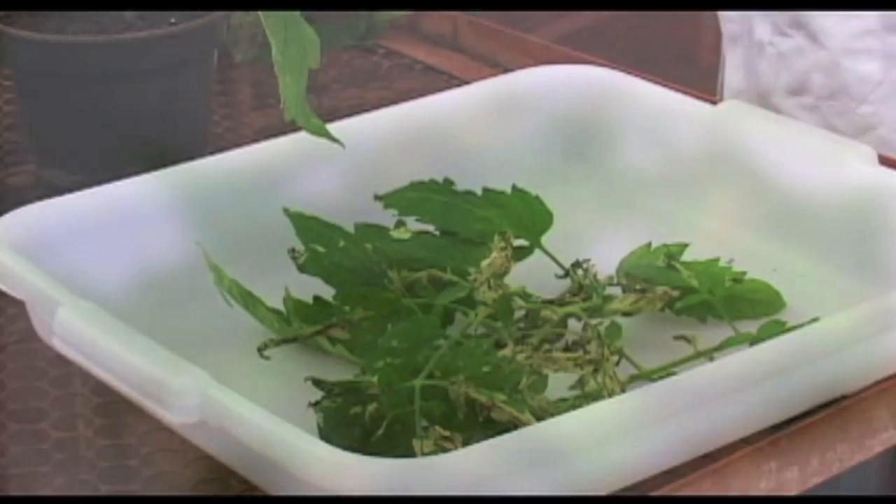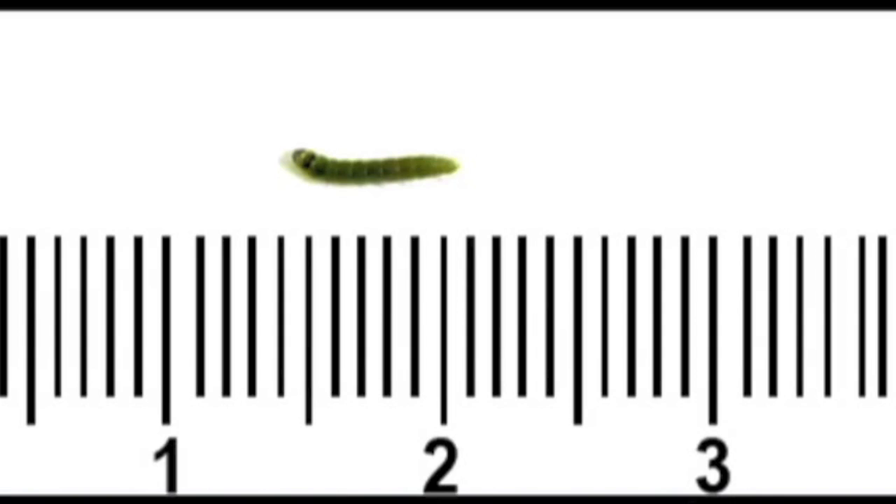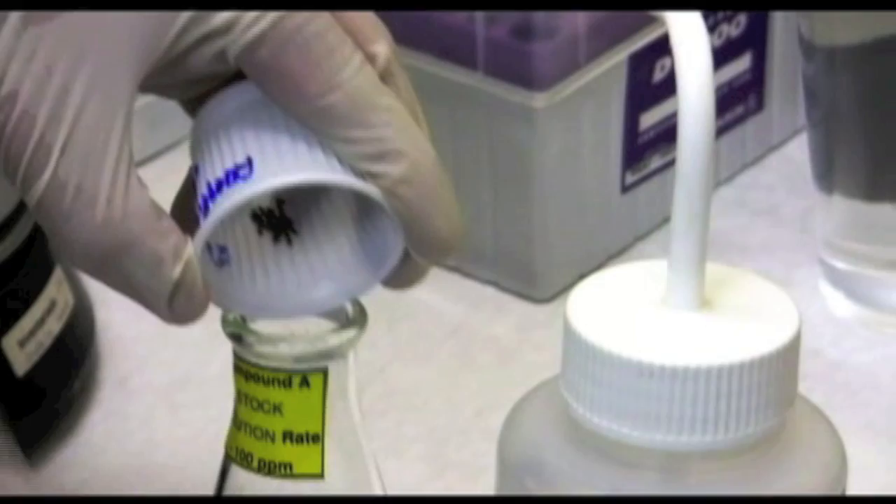This facilitates selection of the larvae of the right size — 4 to 5 millimeters — from the infested leaves. The test should be done with a solution of the formulated product. Additional information about solution preparation is contained in the IRAC Method 22 description.